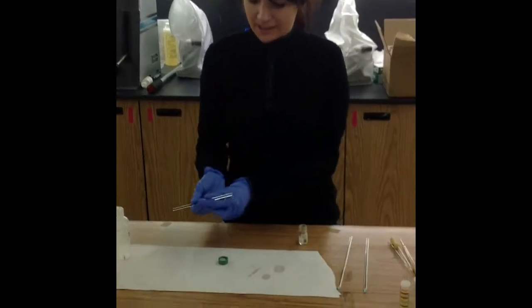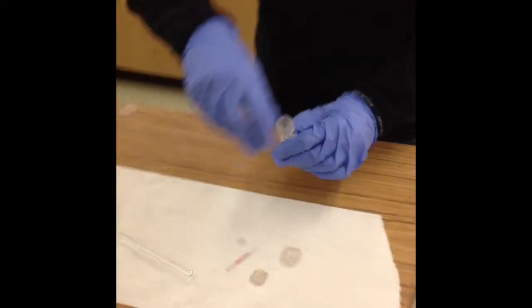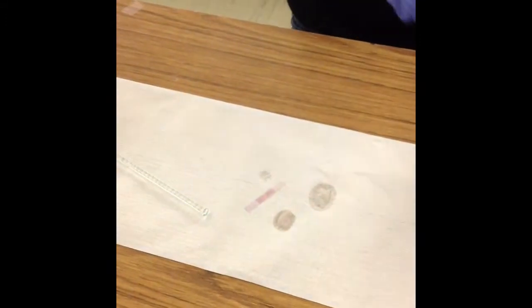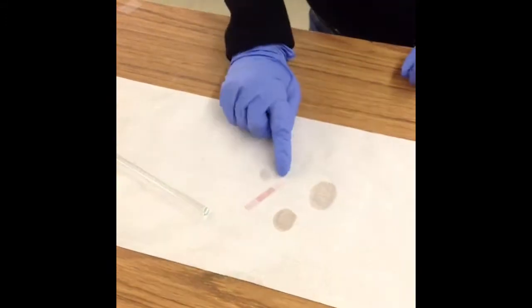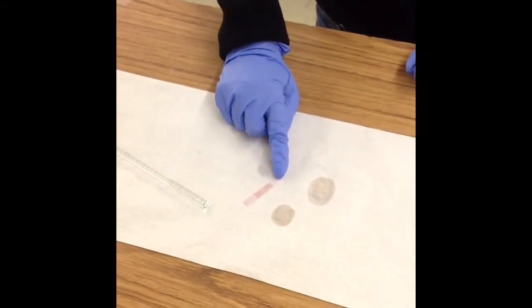Since the GC can't take a pH under 7 or water, it's important to do this. And as we can see, the litmus paper is showing a pH under 7, so I cannot use the sample.